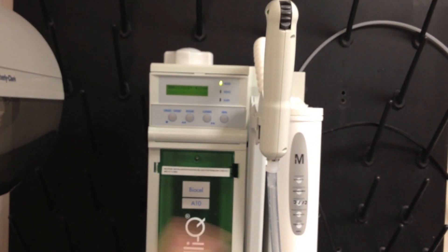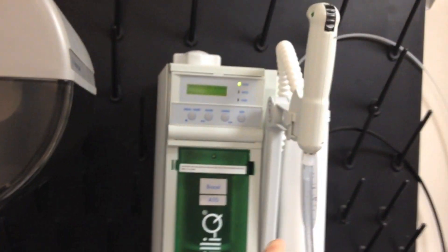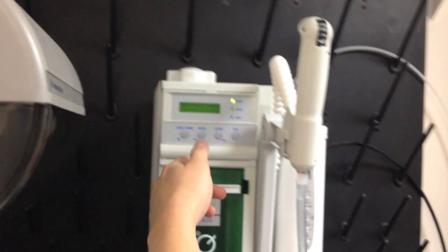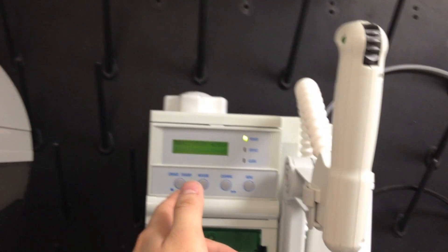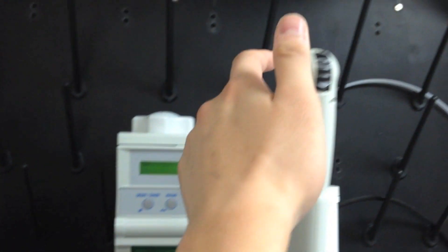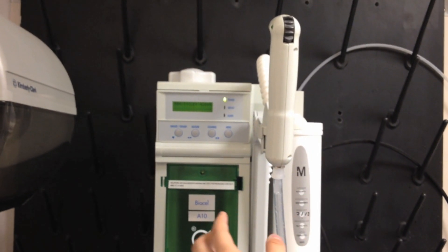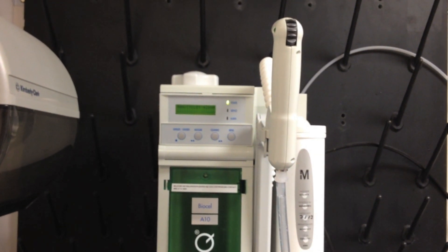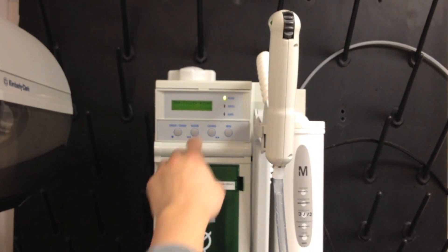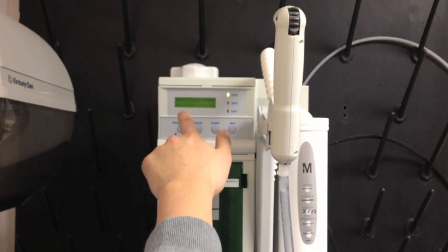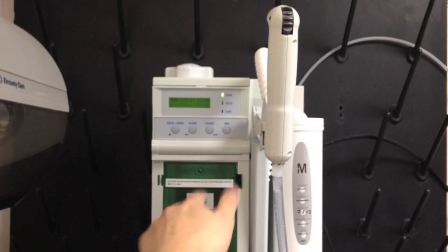So we normally do it overnight. After the other 400 minutes countdown, it will automatically go back to pre-operate mode. And then you just first unscrew this Teflon tube and put the filter back on. And you allow the water to run several minutes before the resistance number and the TOC number go normal.